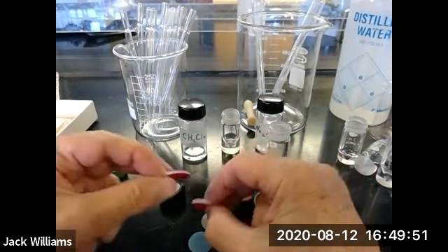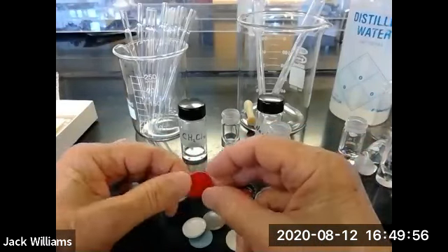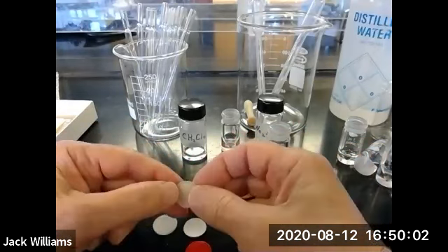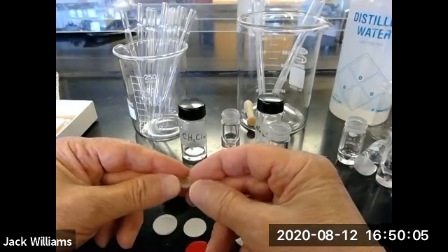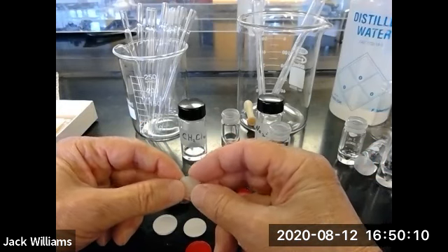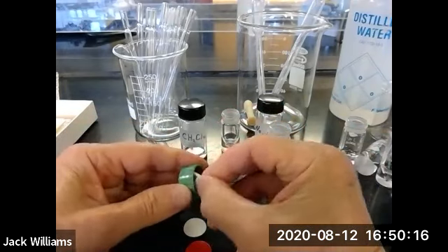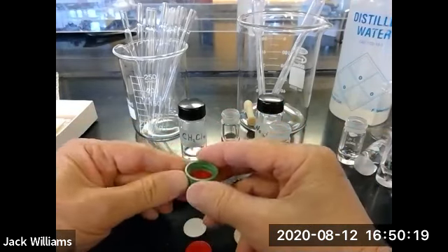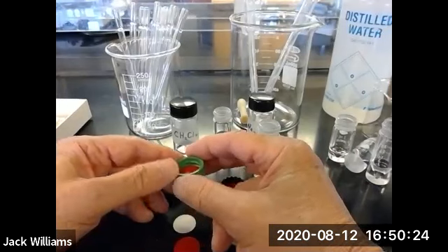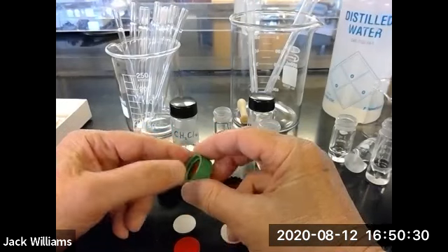Now, in this case, this is easy because you can really spot the 2 layers. This is a lot more expensive than this because now I've got 2 layers of Teflon. So obviously, you're going to see more of this in your kit. This is probably the least expensive. There shouldn't be any confusion when you look at this because you'll know which is the Teflon side. Okay, so this goes into your cap, like so. You're going to be wearing gloves. I'm not wearing gloves because I'm trying to do this for my Surface Pro, and as I said, everything's backwards. So it takes a little time, but you're going to be wearing gloves just to be safe.